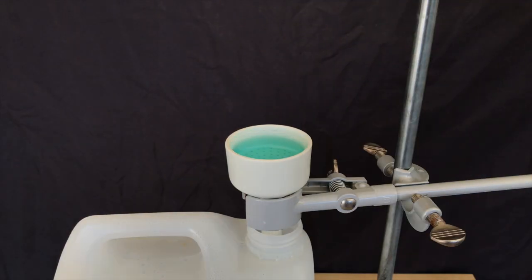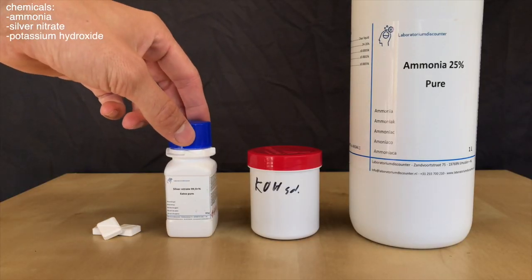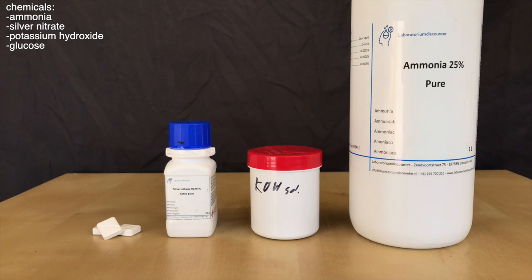Silver is valuable and therefore I filtered the solution to keep the silver. For the next experiments, we are going to silver coat some glass. For this, we will need ammonia, potassium hydroxide solution, silver nitrate and glucose.